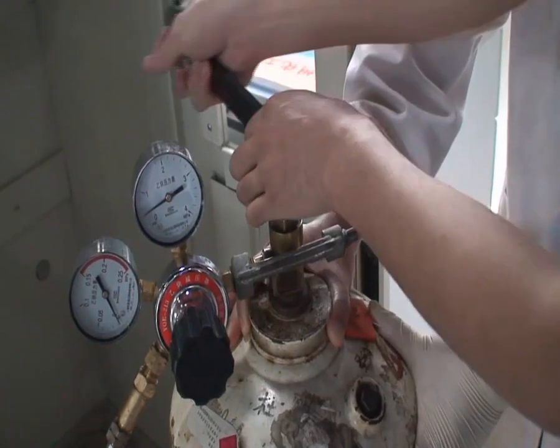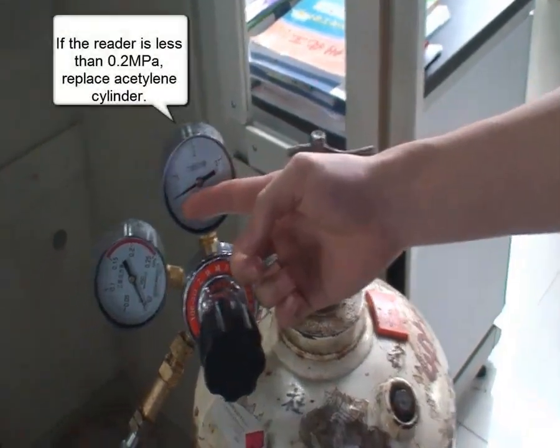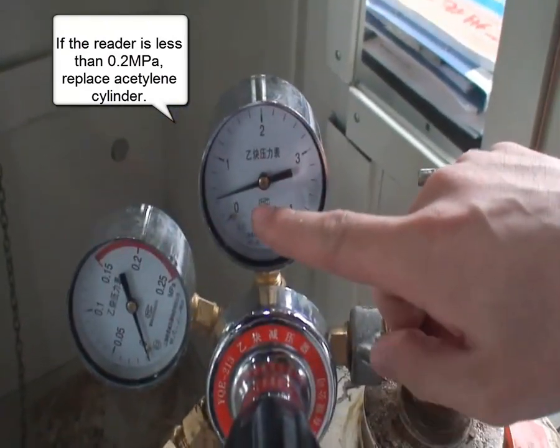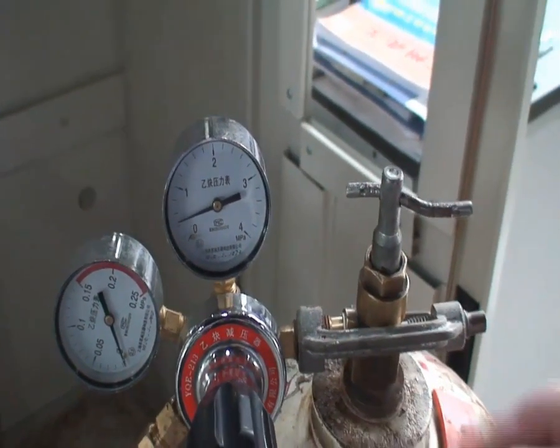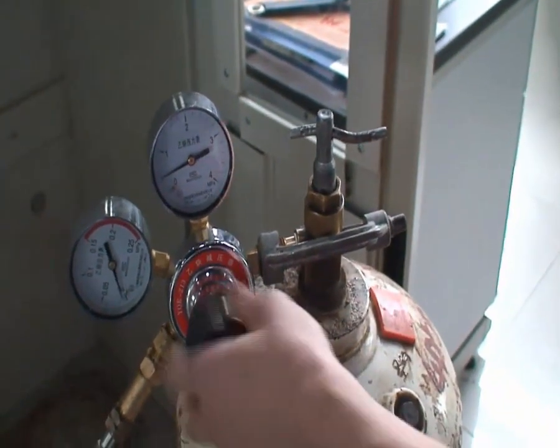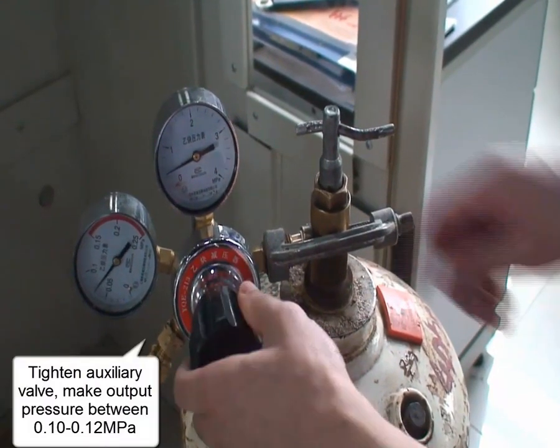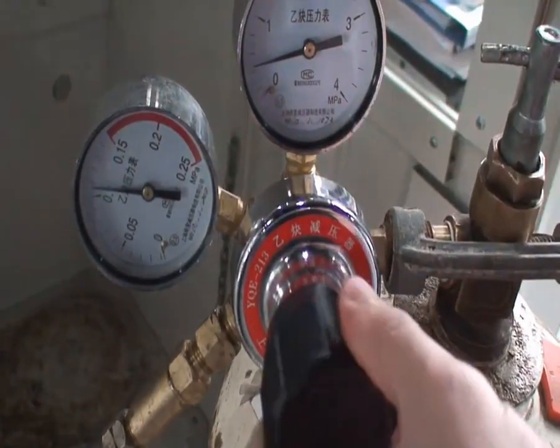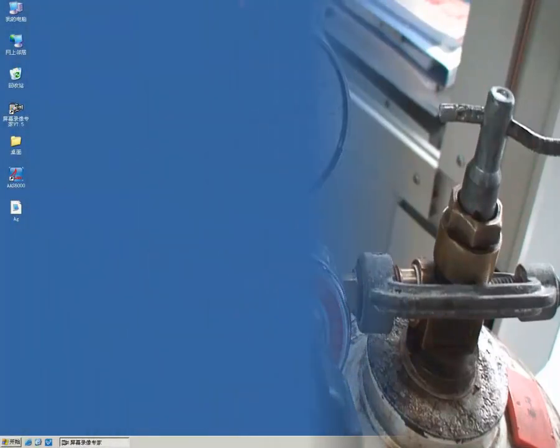If the pressure reading is less than 0.2 MPa, replace the acetylene cylinder. Tighten the auxiliary valve and make the output pressure reach 0.1 to 0.12 MPa. If the acetylene cylinder has not been used for a long time, please inspect for leakage first.